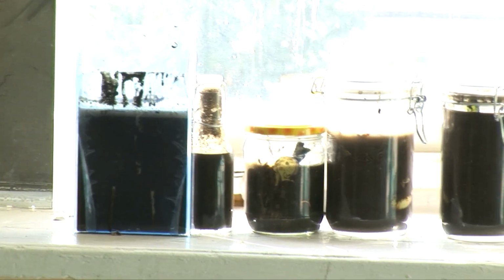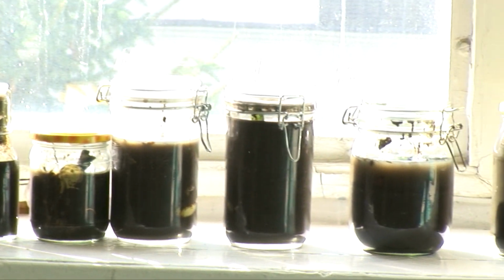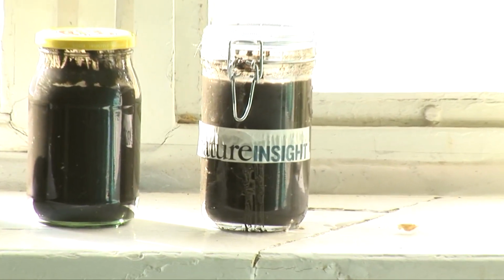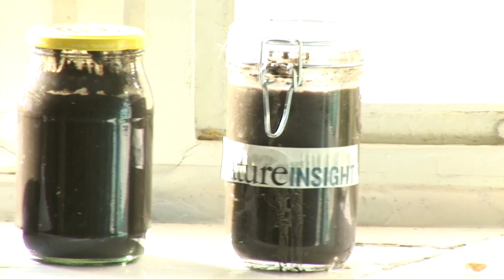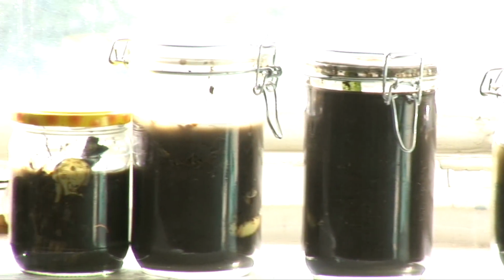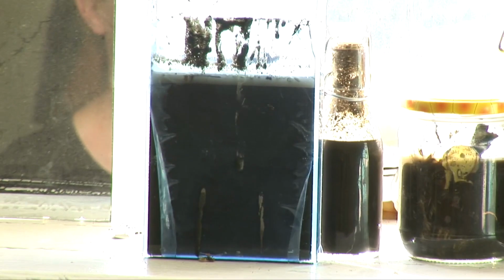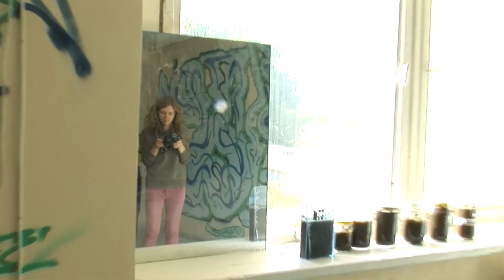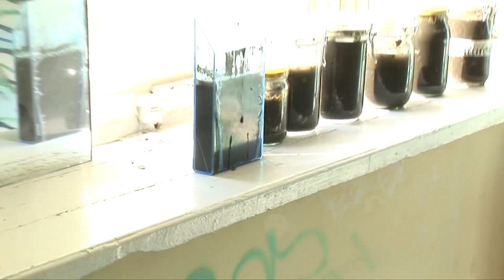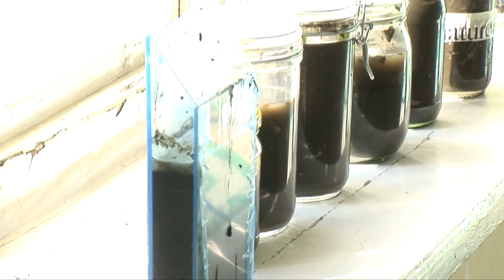And then your final stage is to put it somewhere. You can experiment. You might want to make one that you put in the light. You might want to make one exactly the same that you put in the dark. You might want to partially cover your Winogradsky column. But you put it somewhere where you're interested in how it's going to respond to the environment. This is something you can change. You can keep it in the dark, then you can put it in the light, and you can observe.